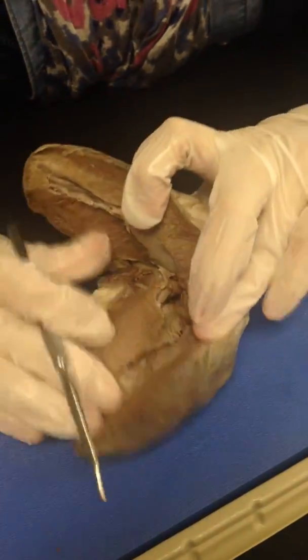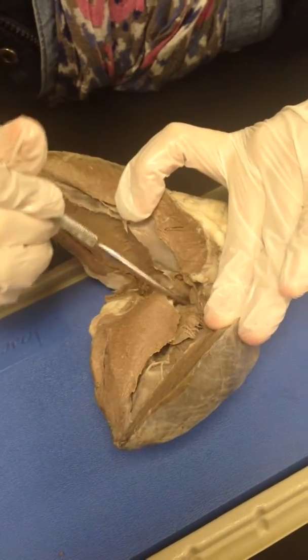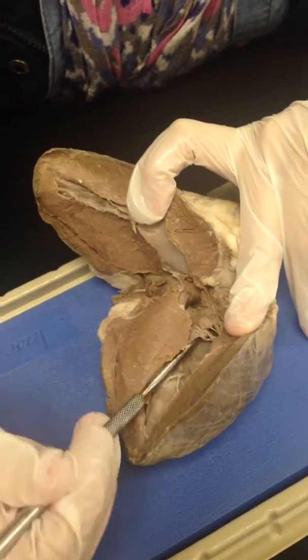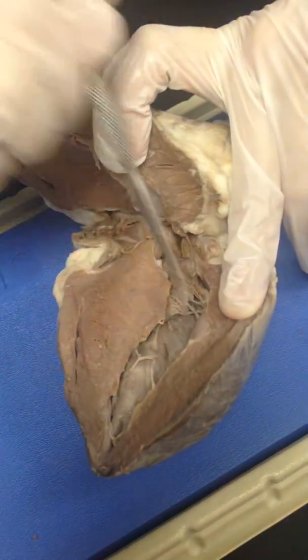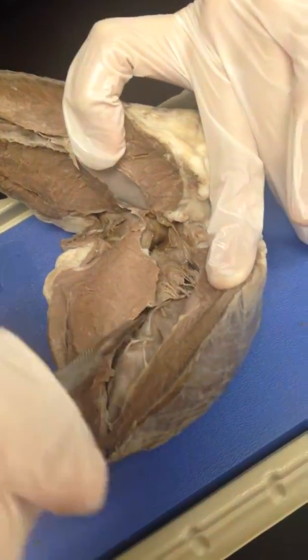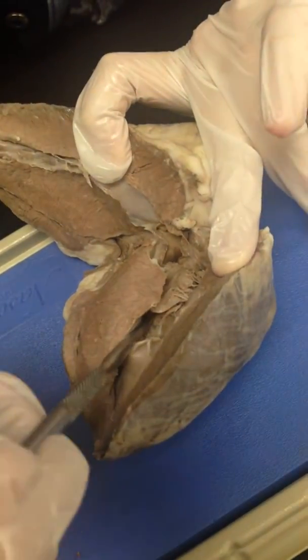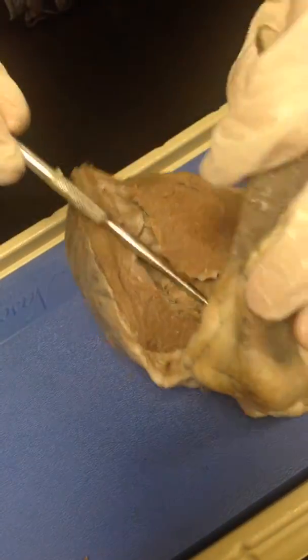Oh, sorry, wrong side. It will go from this part, which will be the left atrium. It'll go through the bicuspid valve. This is a bicuspid valve, but it's all mushy. Can you see it? It'll go right through the left ventricle, and then up, up, up again. If we could see it, up again through this side, all the way up to the aorta right here. Can you see the aorta hole right there?